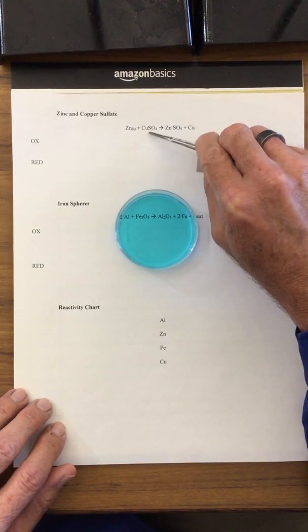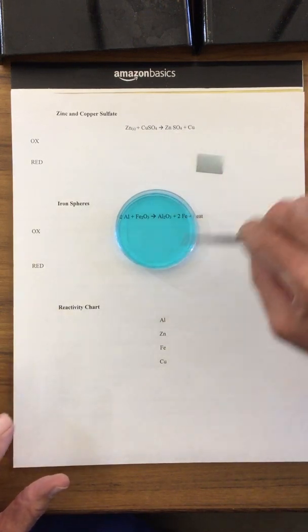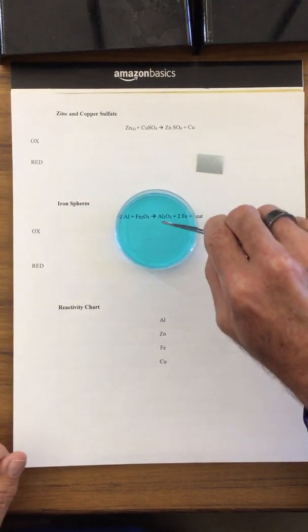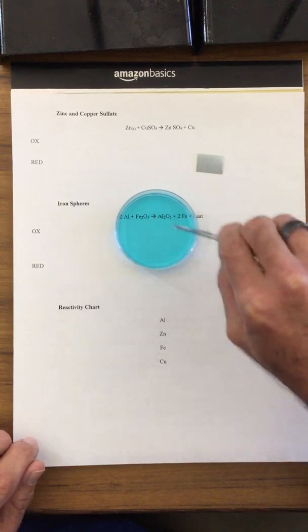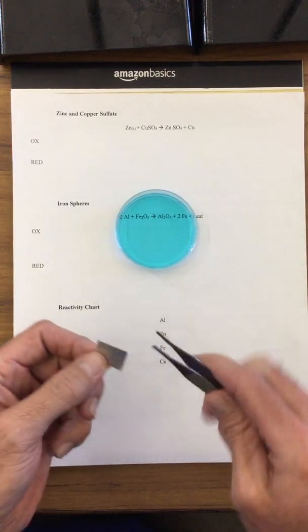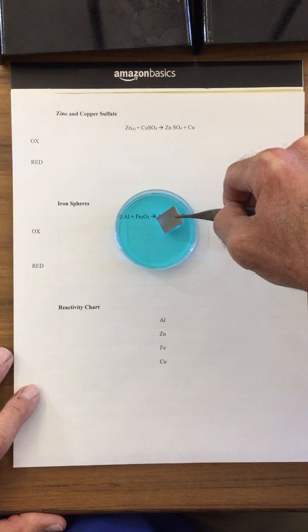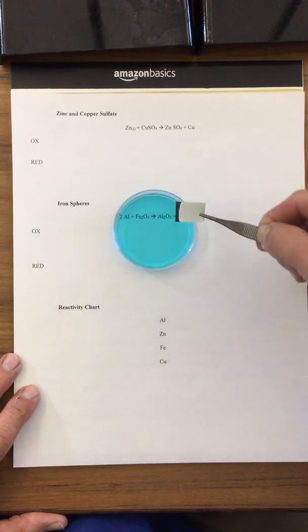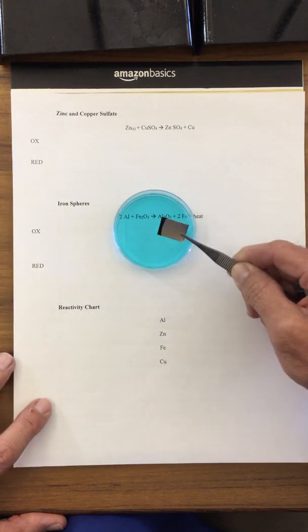The copper actually is not pure raw copper. It's actually copper sulfate, which means that it's dissolved or aqueous inside of the solution, meaning that this is in an ionic form. So I have an ionic form of copper in this liquid, which is making it appear blue, and I have this metallic zinc. So if I put the zinc into the copper sulfate, it's going in nice and silvery, and just with the contact for a few seconds, we see that we have this chemical reaction taking place.